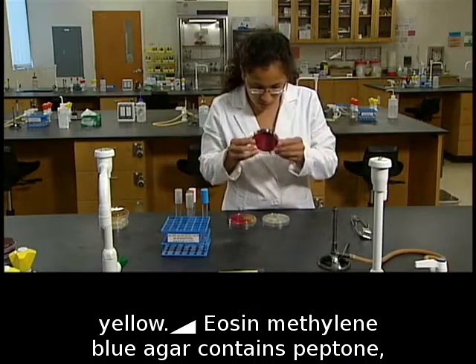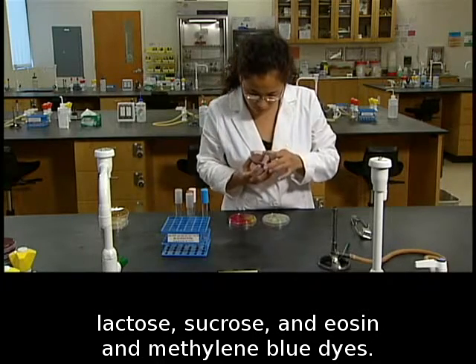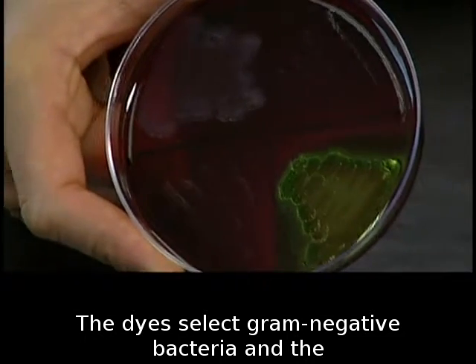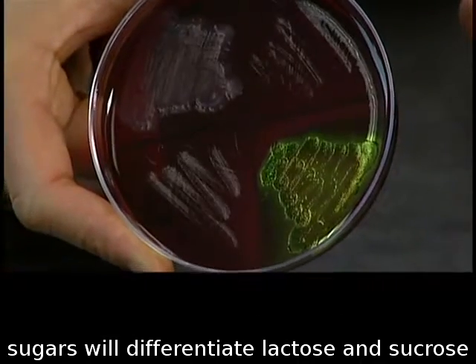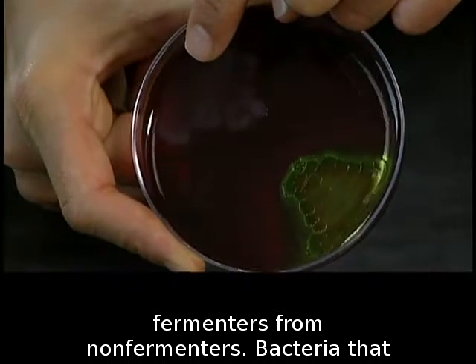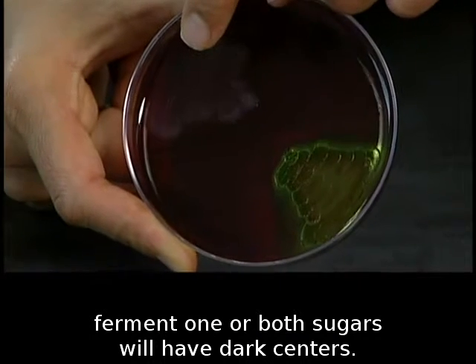Eosin methylene blue agar contains peptone, lactose, sucrose, and eosin and methylene blue dyes. The dyes select gram-negative bacteria, and the sugars will differentiate lactose and sucrose fermenters from non-fermenters. Bacteria that ferment one or both sugars will have dark centers.